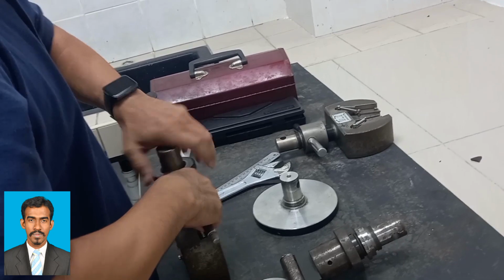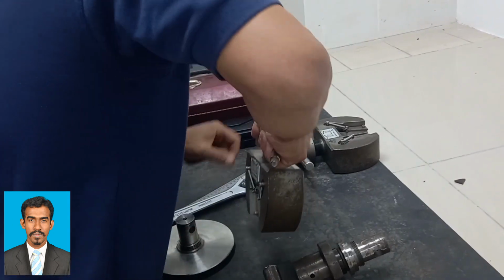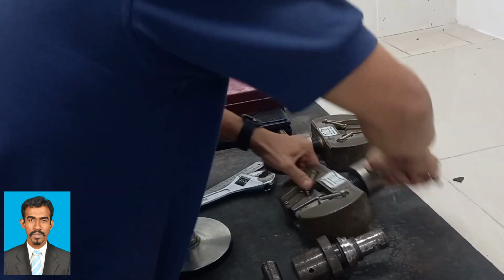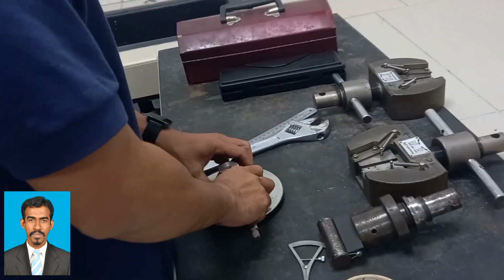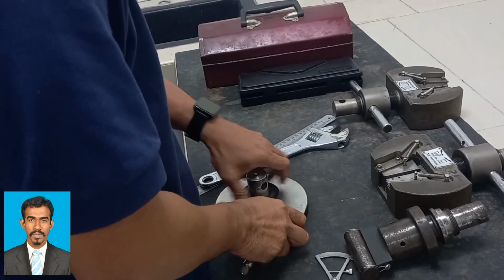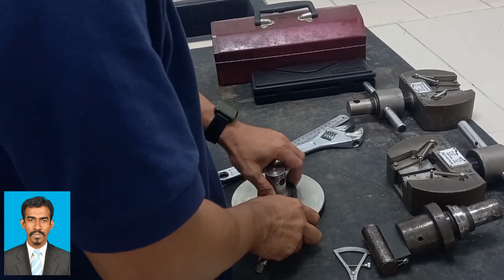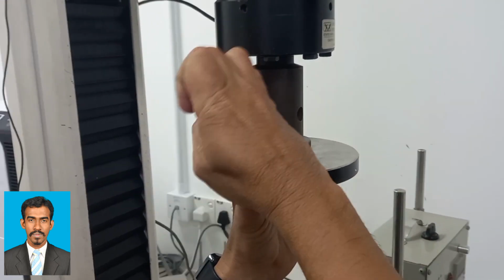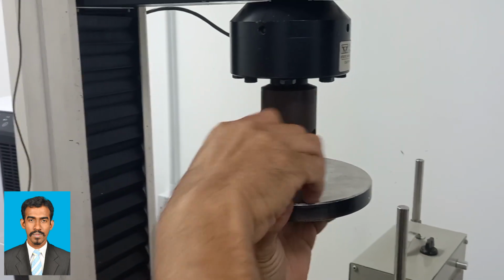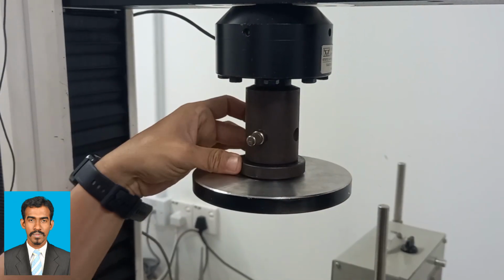With the understanding of these different parameters and the values associated with a specific material, it may be determined whether or not the material is suited for specific applications or if it will fail under the specific stresses. A compressive strength test measures the compressive load or stress that a material can resist before fracturing.